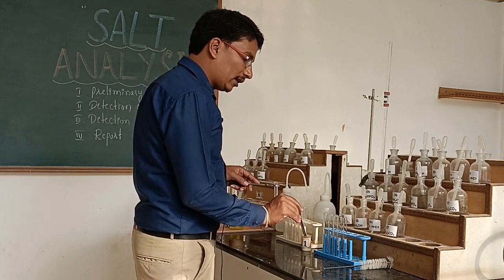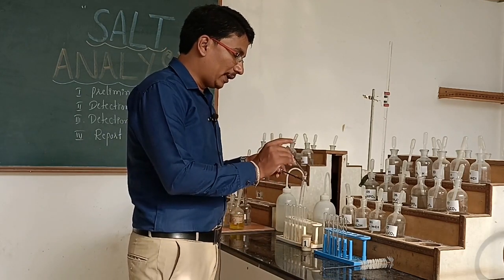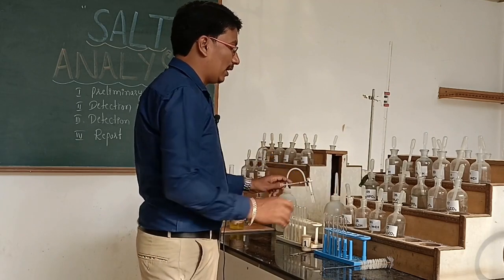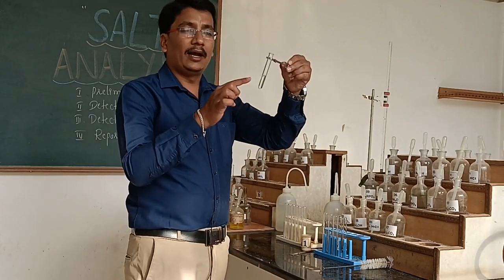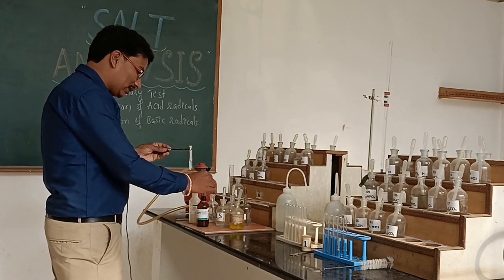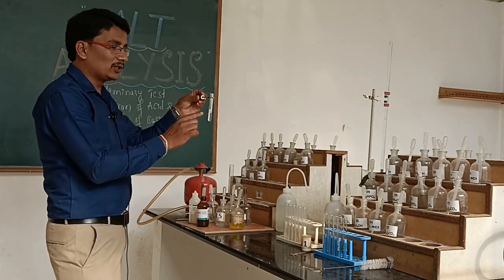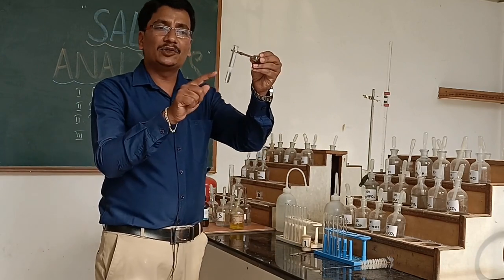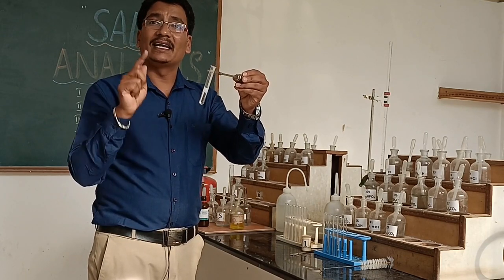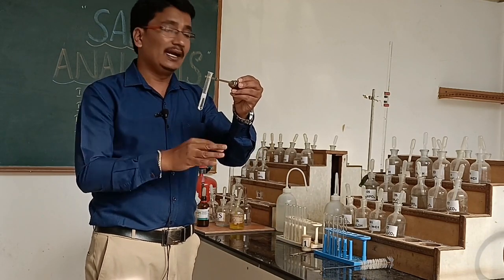The confirmation test for chloride ion is the silver nitrate test. We prepare a salt solution using water, since the given salt is soluble in water. To the salt solution, we add silver nitrate solution. When we observe a curdy white precipitate that is soluble in excess NH4OH, this confirms the presence of chloride ion in the given salt.